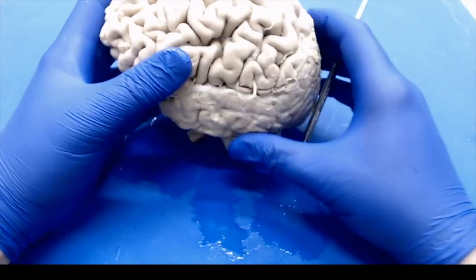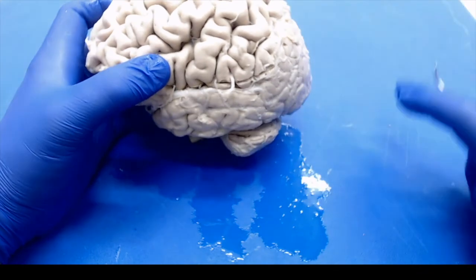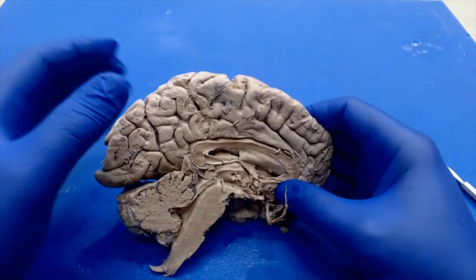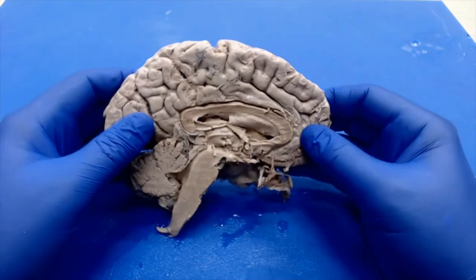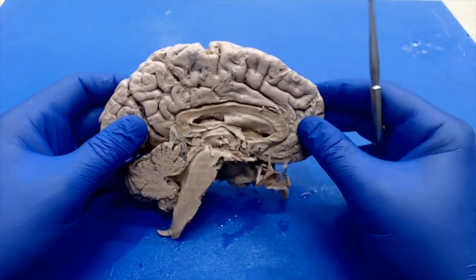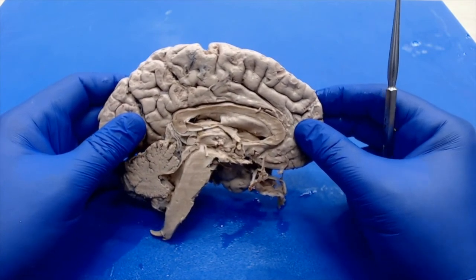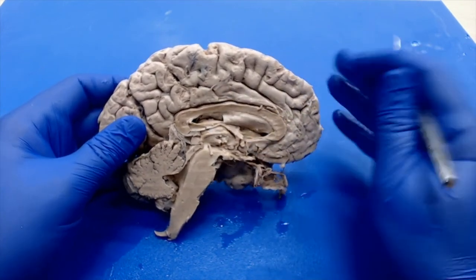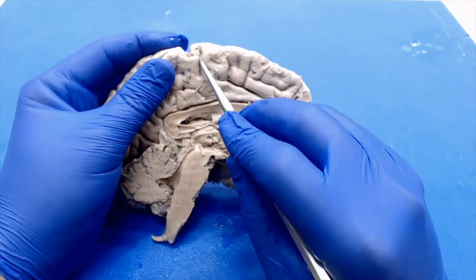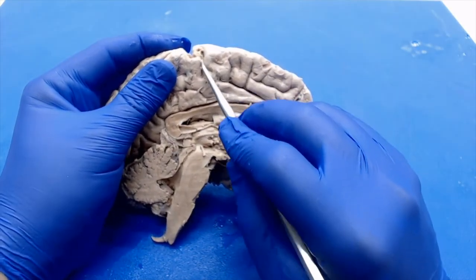That's the basics of the external anatomy. Now we're going to look at the internal anatomy of the brain before we start actually doing our cutting. So now we're looking at a hemisection of the brain, and you should be able to easily split the brain into sagittal sections and see what I'm showing you here. Ideally, you'll also be able to identify part of the central sulcus we looked at earlier on the mid portion. It stops halfway here.